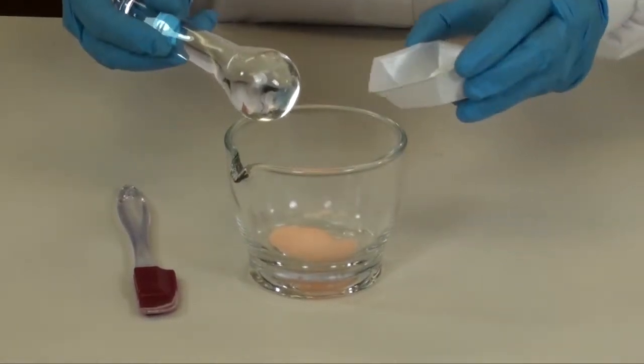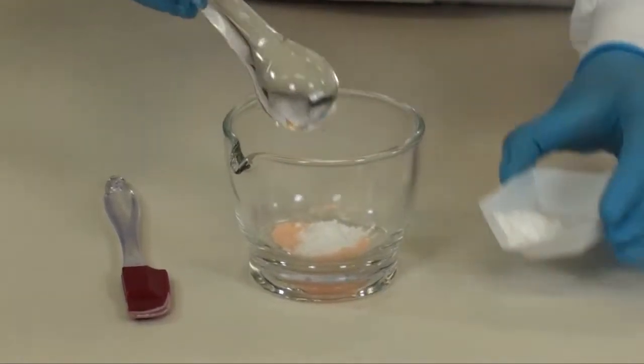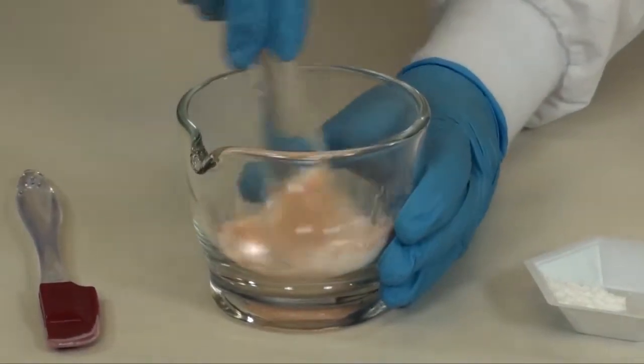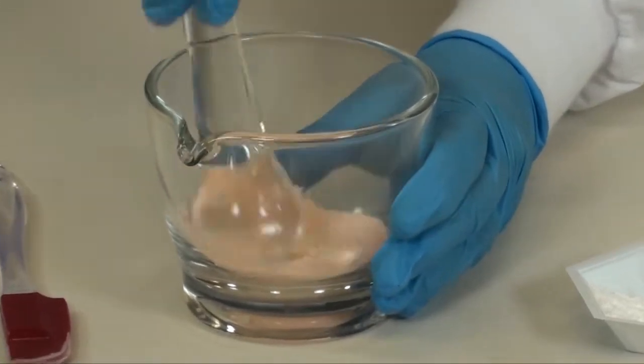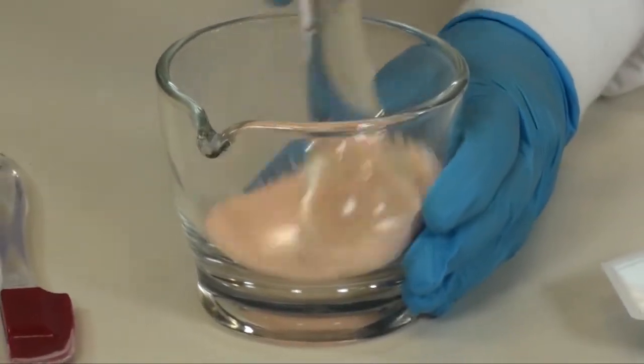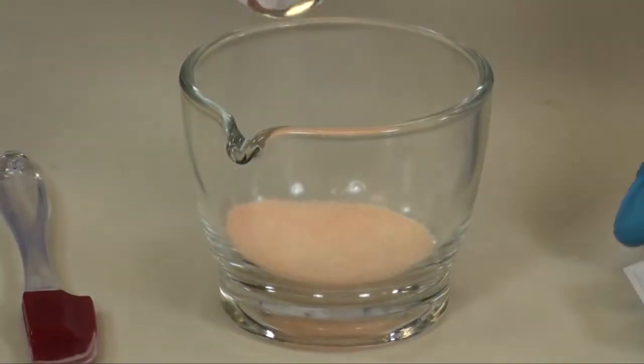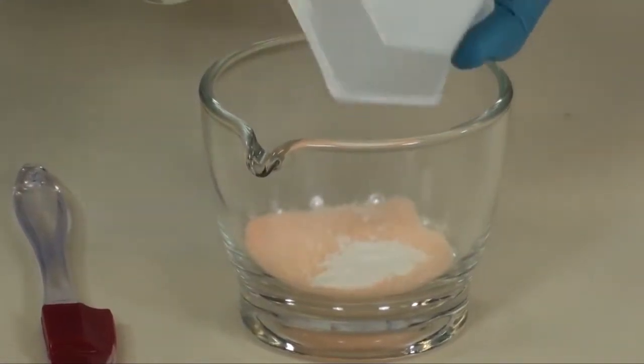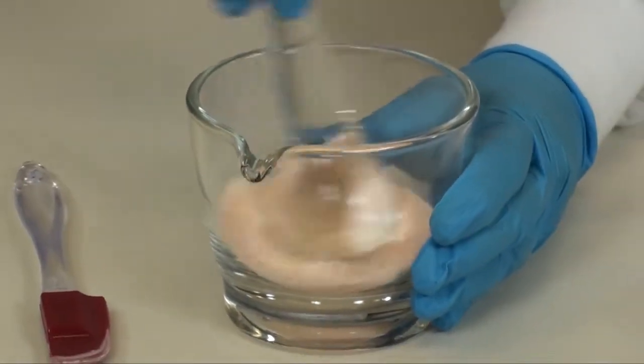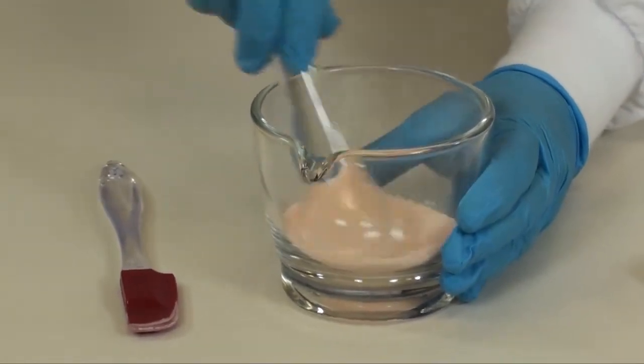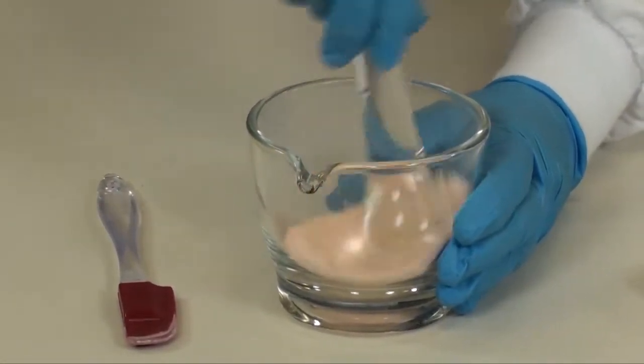Geometrically add the lactose powder and triturate after each addition. The resulting powder should be uniform in color with no white streaks visible.